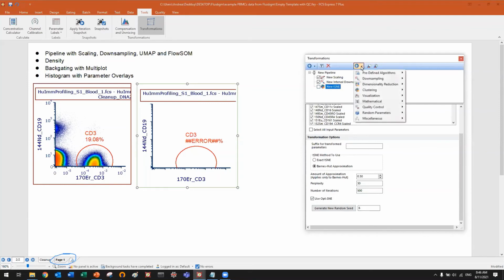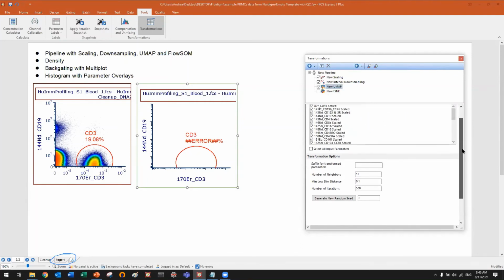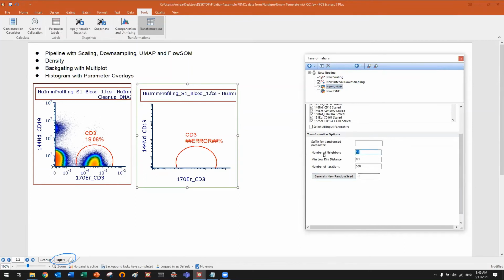Let me also add another one, like UMAP. Let's do the same. I will select all the scaled parameters. You also have a bunch of options like the number of neighbors and the minimum low dim distance. Again, UMAP, as t-SNE, is an iterative process, so you can set the number of iterations here, and so on. And remember, every time we are running a step, we are introducing new data.